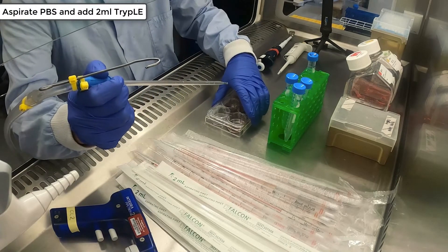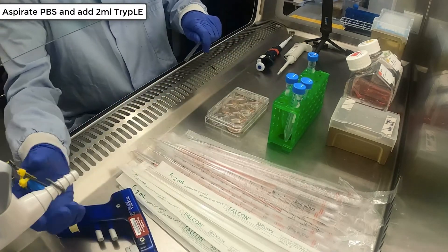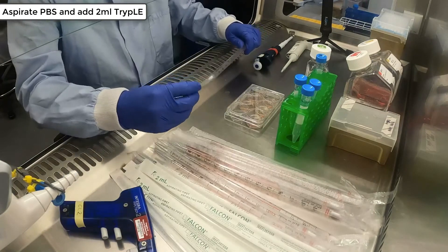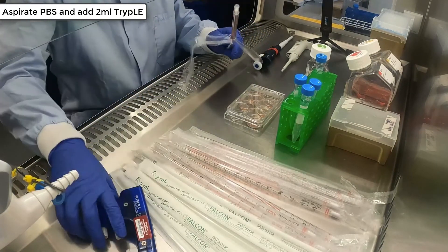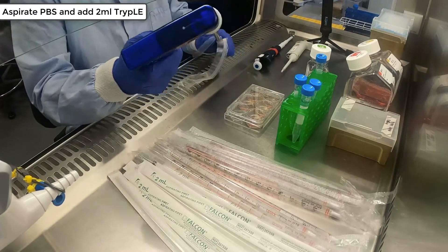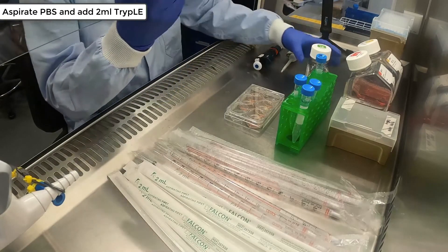Aspirate the PBS from the cell surface, then add 2ml of TrypLE to the well. This is just one example of many single cell dissociation reagents that are available — for example, you could use Accutase instead.